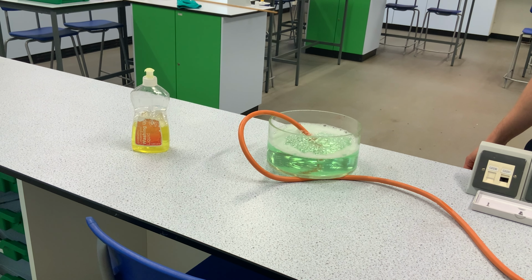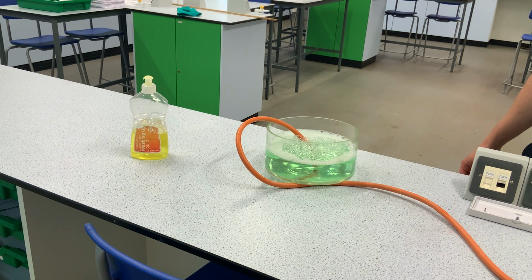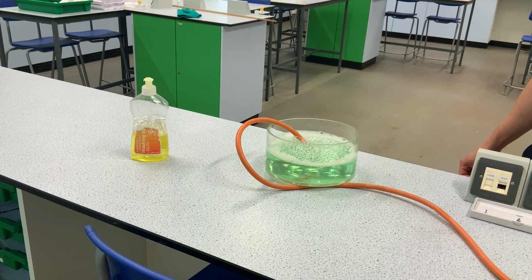Now that we have seen how combustion works with sugar, let's take it a step further with methane bubbles. These are the materials we need for methane fire bubbles demonstration. Same as the burning sugar demonstration, students must stand at least 5 meters away from the setup to ensure that they're safe. To create the methane bubbles, you open the valve on the gas tap until you hear the methane gas. Dip the end of the tubing into the bucket of soap solution.